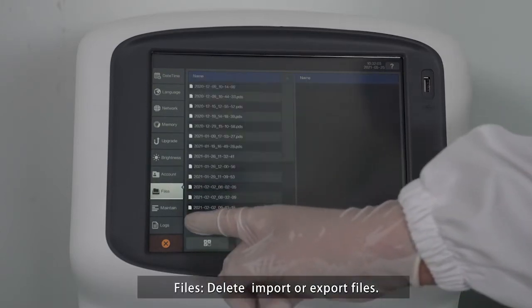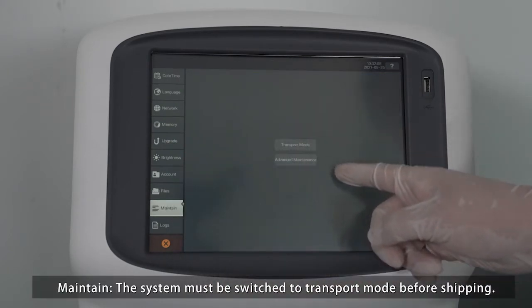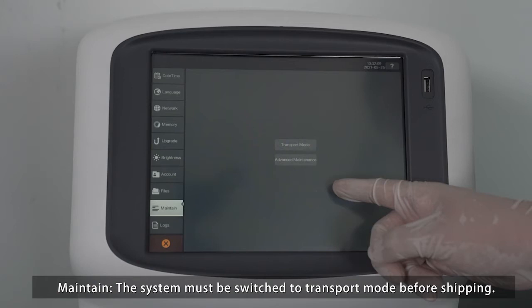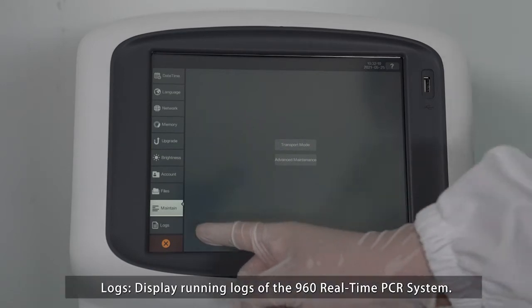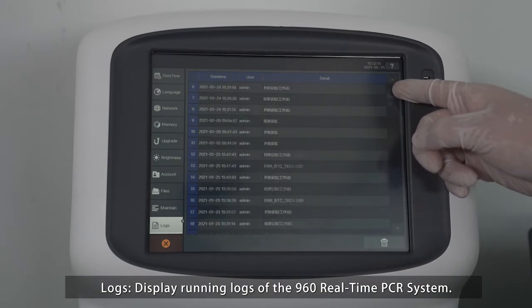Files. Delete, import, or export files. Maintain. The system must be switched to transport mode before shipping. Logs. Display running logs of the 960 real-time PCR system.